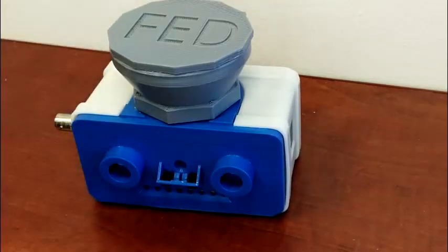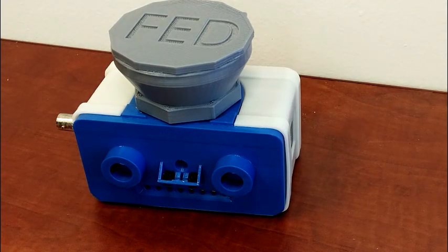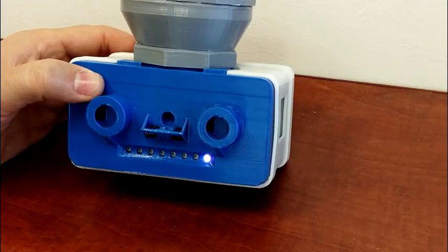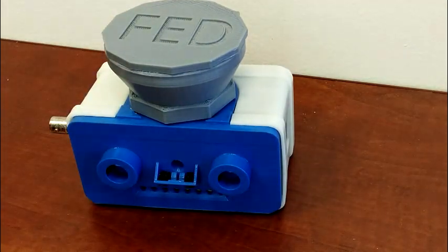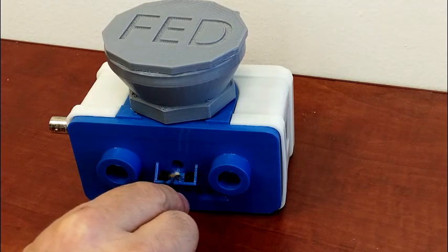Got 3 in a row there. And now the right poke is active, so left does not respond. This will train the animal to learn the visual discrimination of finding which poke is active.